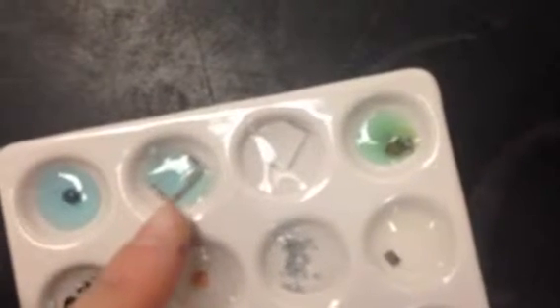The next well is iron, over here, iron and copper 2 chloride. And again, notice that we know what staples look like. Iron has that silvery color, there it is over here if you want to see what it looked like without the copper 2 chloride. And we're actually getting like reddish, this camera really is not that good. There's more focused. So in this well right here is the iron with the copper 2 chloride.